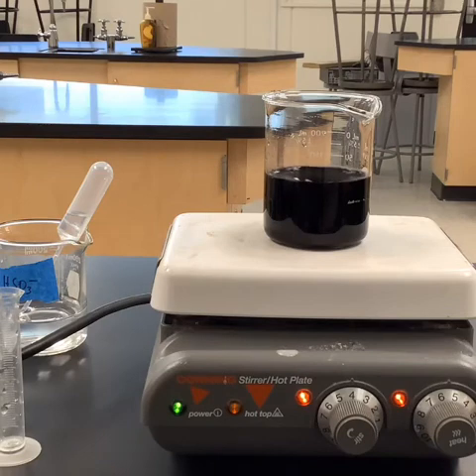That one was a fast one. I hope you guys caught it. You should have been expecting it to take less time because we had a higher concentration, right? So that one was pretty quick. Let's go ahead and mix up and get ready for our last trial.